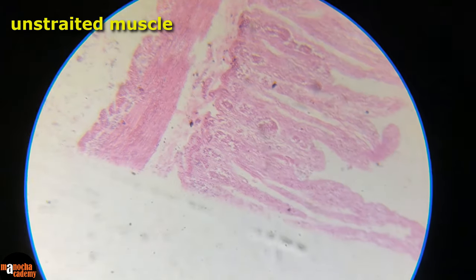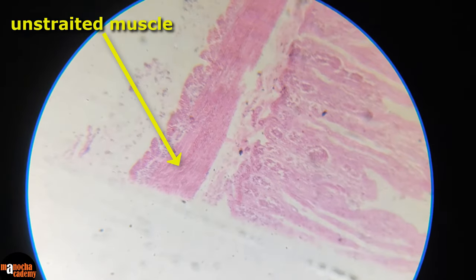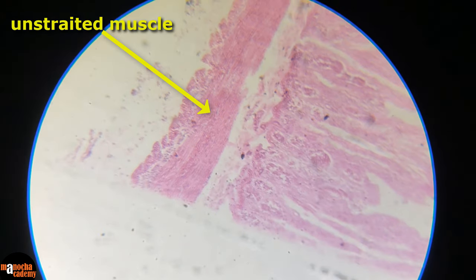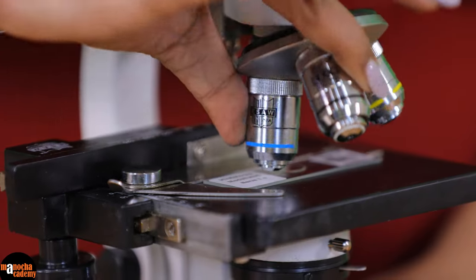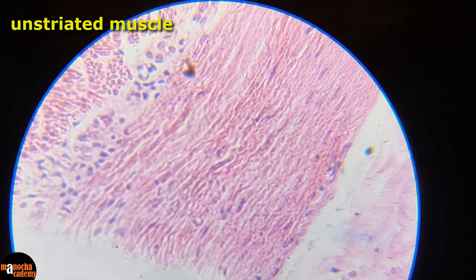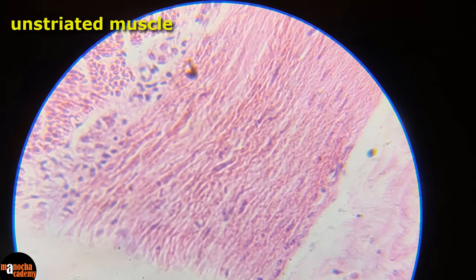This is how it looks at 100x magnification. It is not very clear because these are really small cells. We will magnify it further to 450x. Now you can see the cells and you can probably also recognize the spindle shape of these cells.